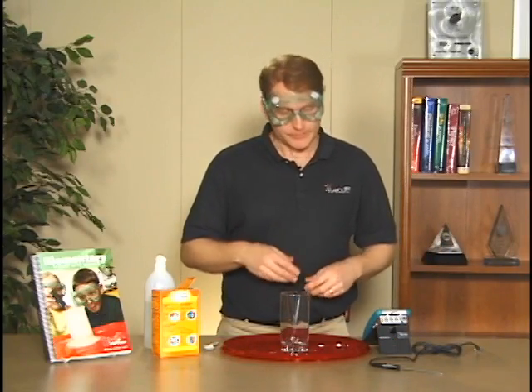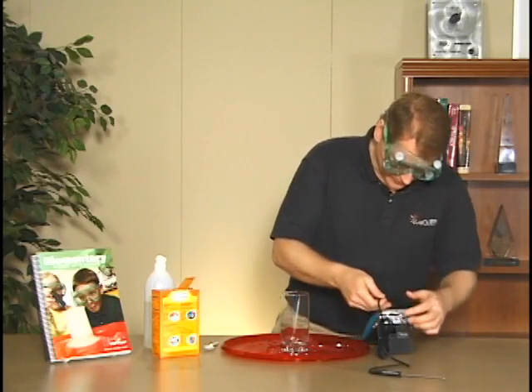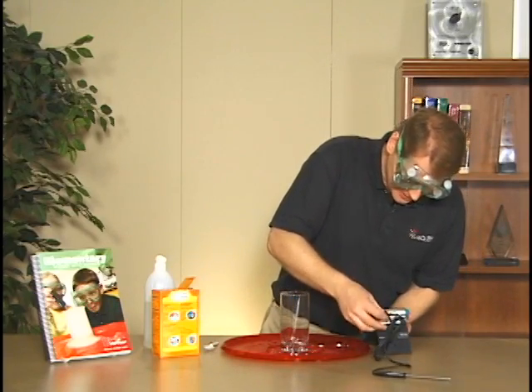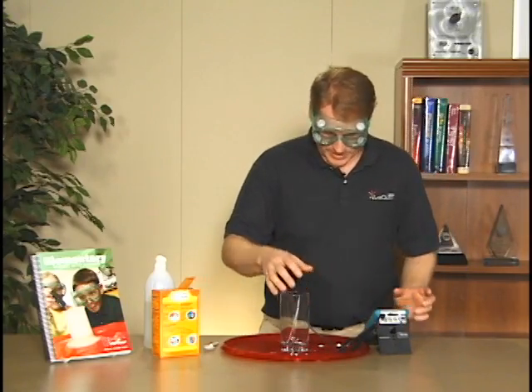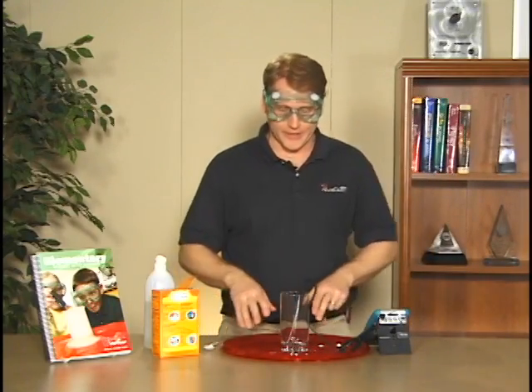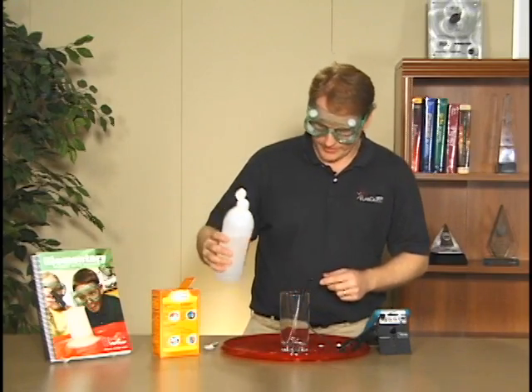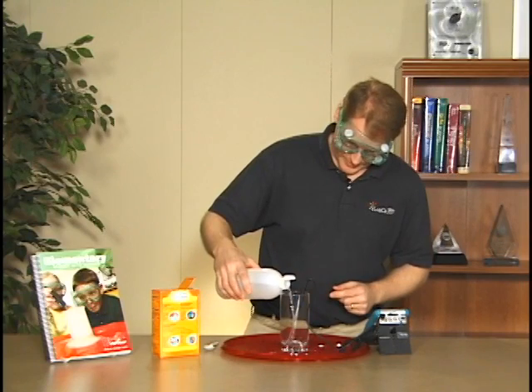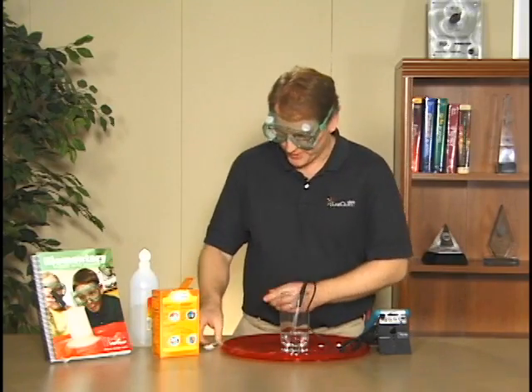To start off, I will just plug in my temperature sensor, put it down into my glass, and we have this tray here in case I get excited and make everything go all over the place with too much vinegar and baking soda. I'm going to put some vinegar in there—the book specifies how much to use, but that looks pretty good.